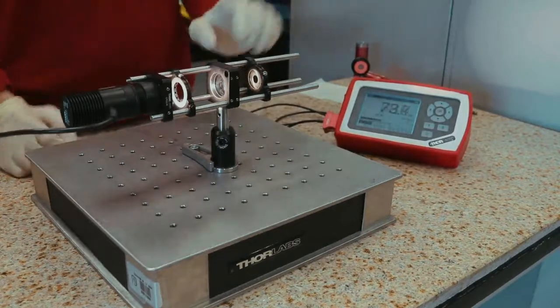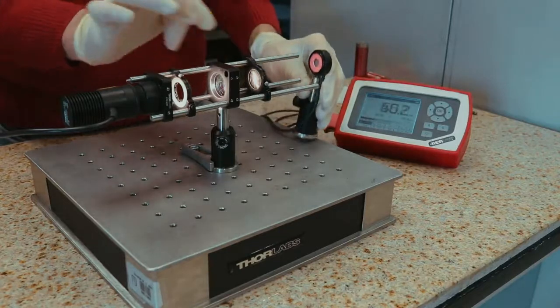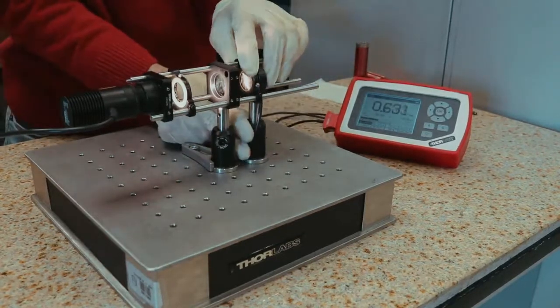Similarly to step 2, adjust the position of the aperture diaphragm until achieving the maximal intensity on the photodiode power sensor. Fix the iris in position as before.